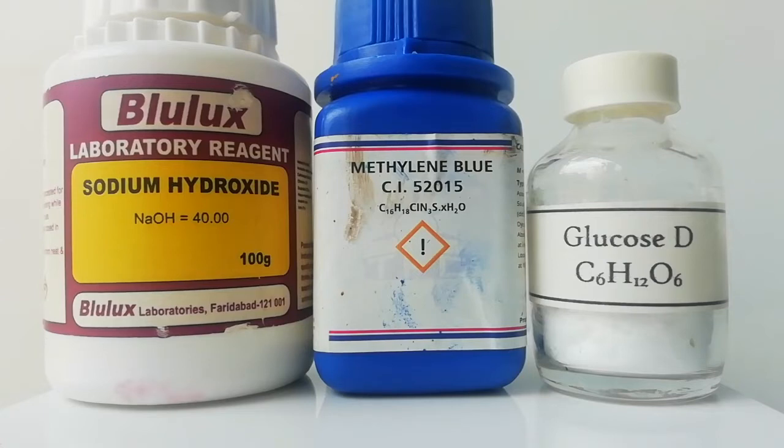For the experiment I am going to use sodium hydroxide, glucose, and methylene blue.